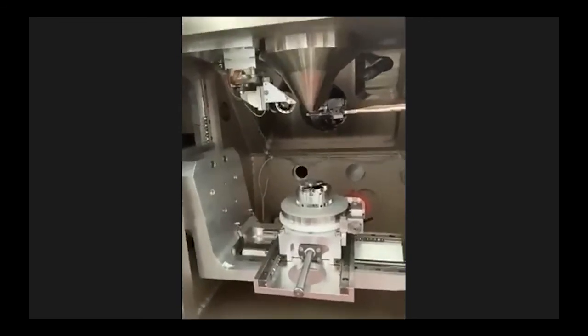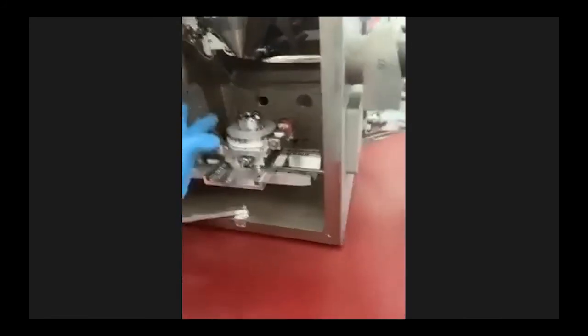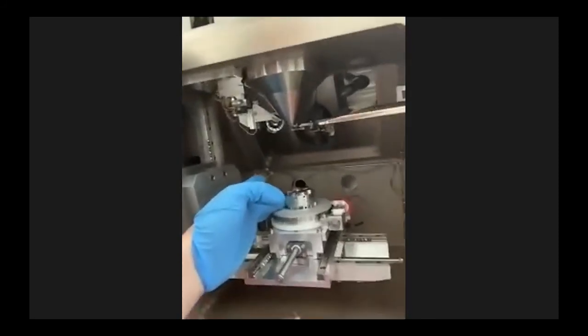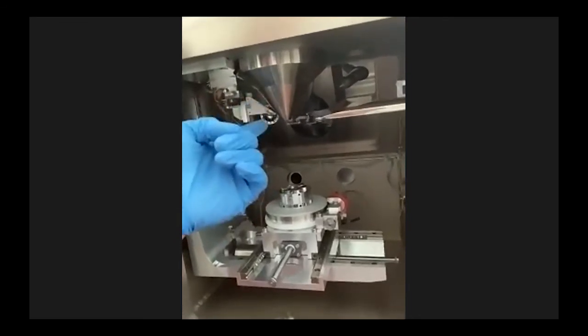So the stage, oh, wait a minute, I need to close. I will be able to touch it. Yeah. So the stage looks similar, just the chamber is much bigger. Then here is again the electron beam column.